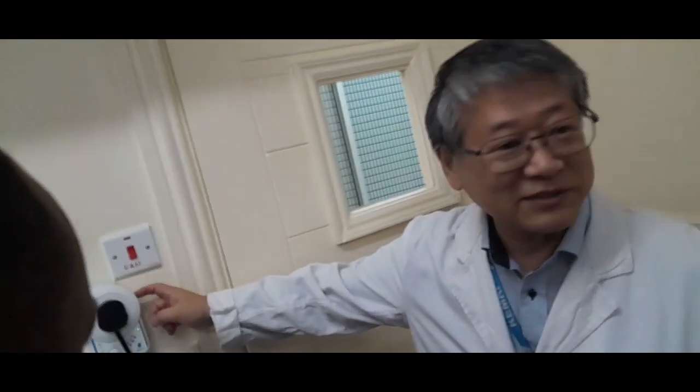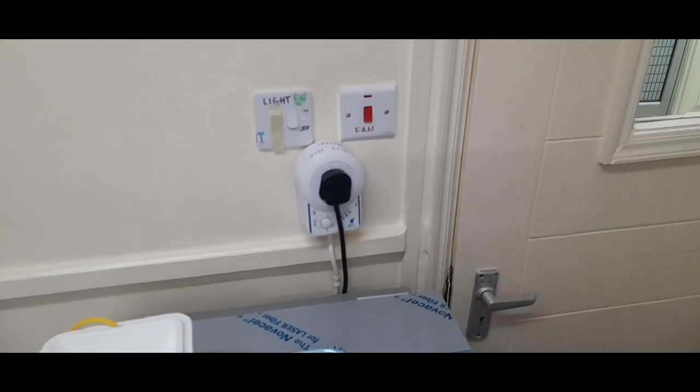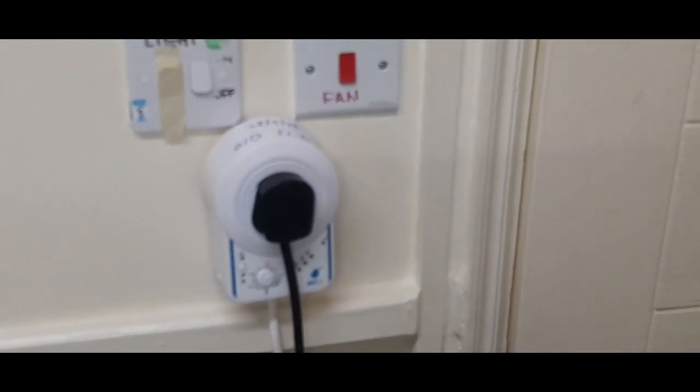Also, this is AVS for the autoclave, since autoclaving should be completed in 15 or 20 minutes at 121 degrees Celsius. So if a sudden stop happens during that 15 or 20 minutes, the sterilization becomes incomplete, isn't it? So it's quite dangerous.